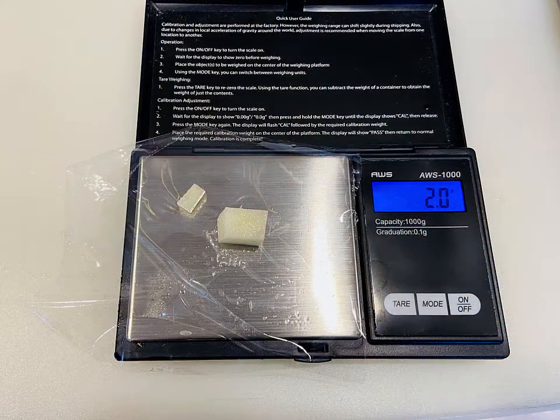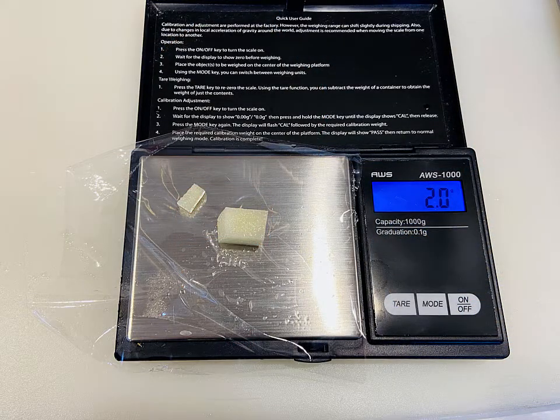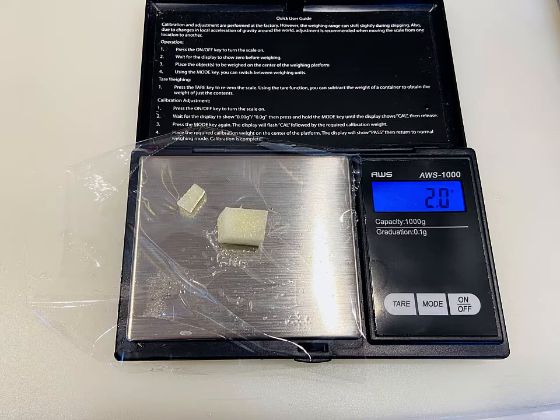In this experiment we tested liver, beef, potato, carrot, pineapple juice, and water for the presence of catalase.